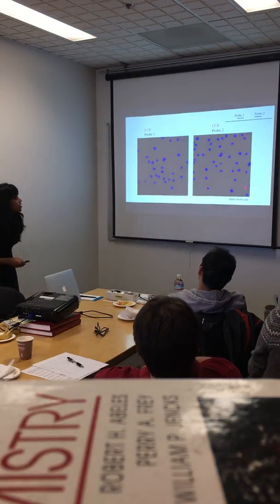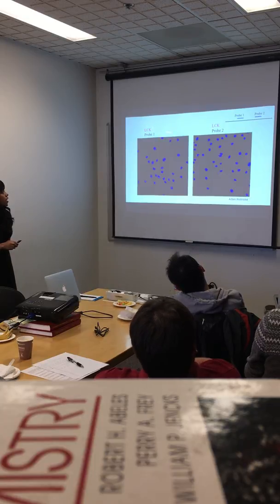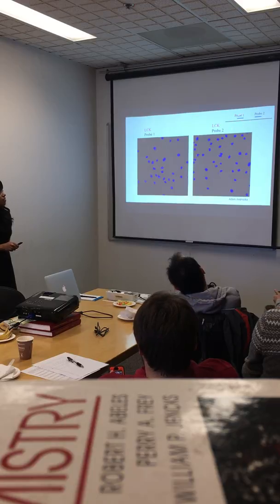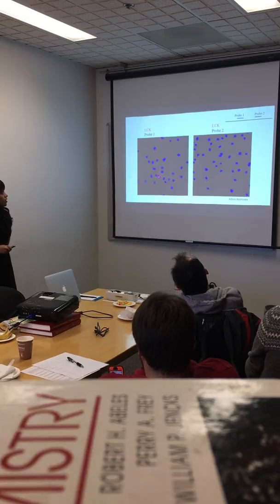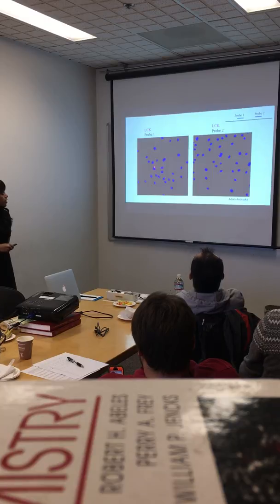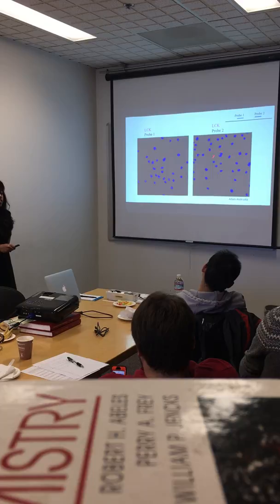Okay. So this is an example where we are looking at an in situ for the LCK mRNA. Two probes were designed targeting different regions along the mRNA. And you can see that this probe gives good signal. Basically what you see in magenta is the signal. And the second probe does not give good signal.